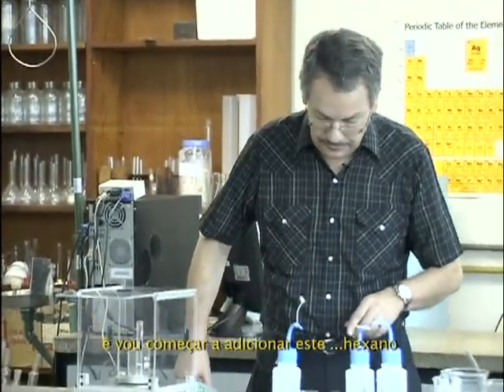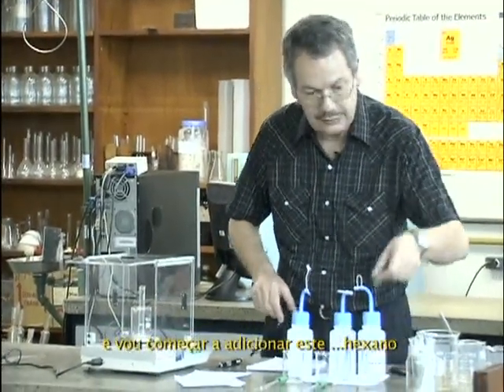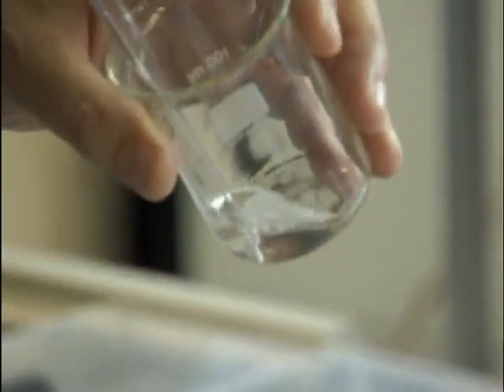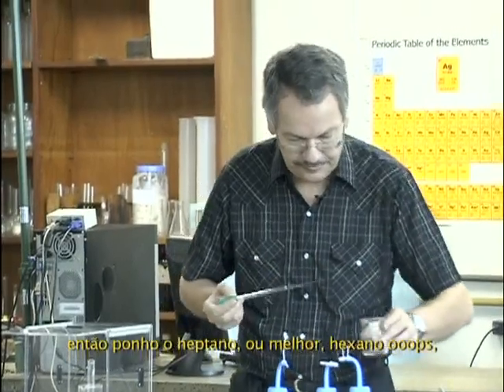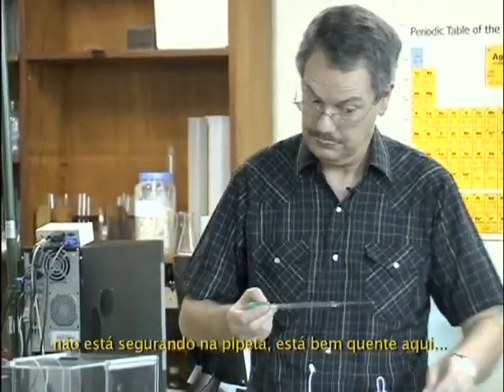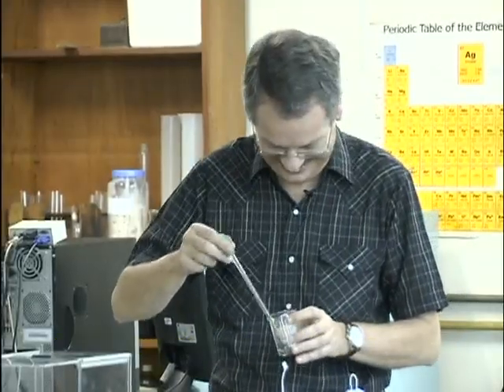Put 0 to have the reference value. And I will start to add, which one is it? This one, hexane. So I take hexane, oops. It doesn't stay in the pipette, it's very warm here.